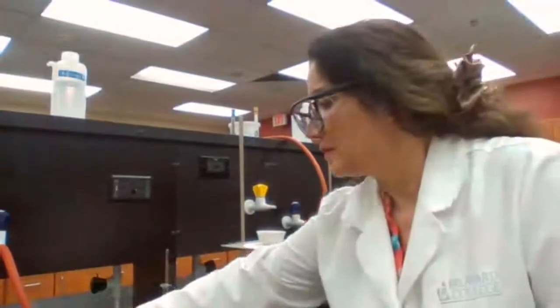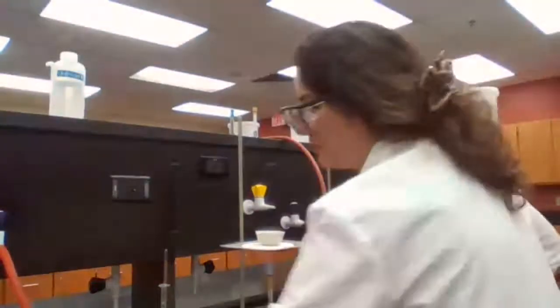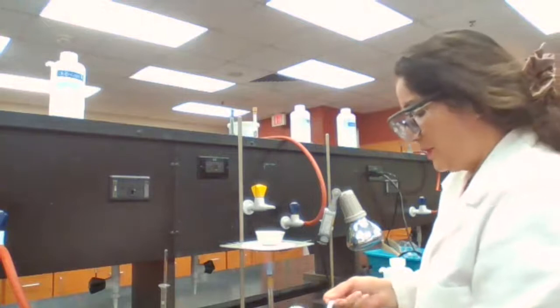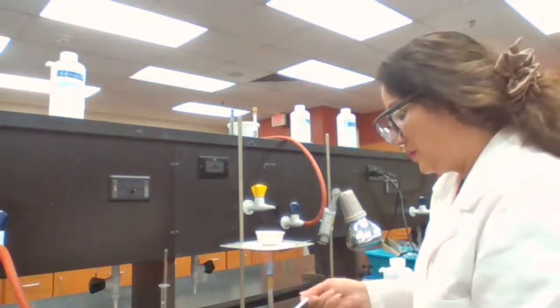Going to start. I need to do the second half of the experiment. This one part of the experiment, I missed it for experiment 2.